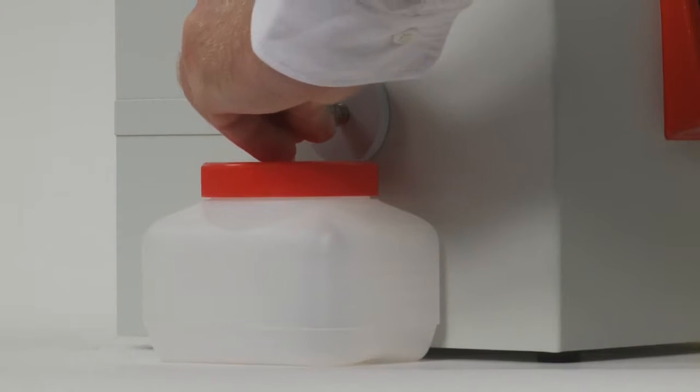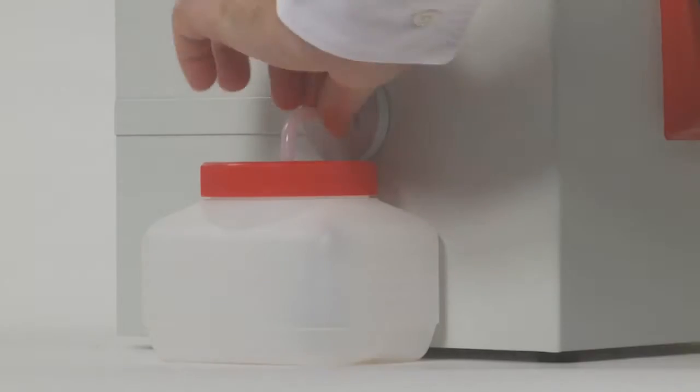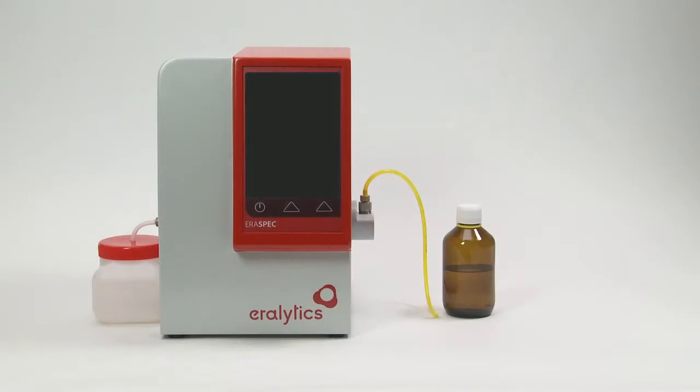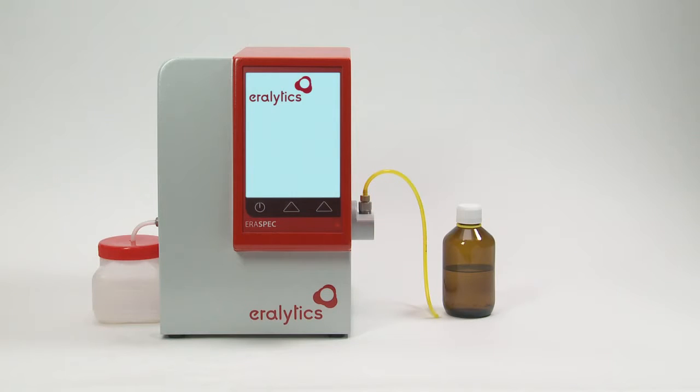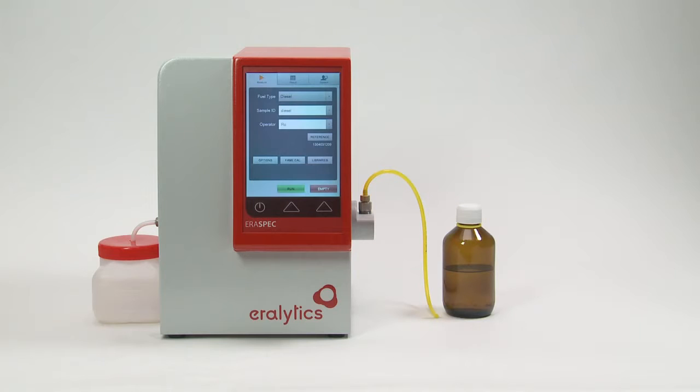Switch on the analyzer by pushing the power button on the front. After a few seconds, the instrument performs a reference measurement. This takes about 45 seconds. Please wait until the reference measurement is finished.